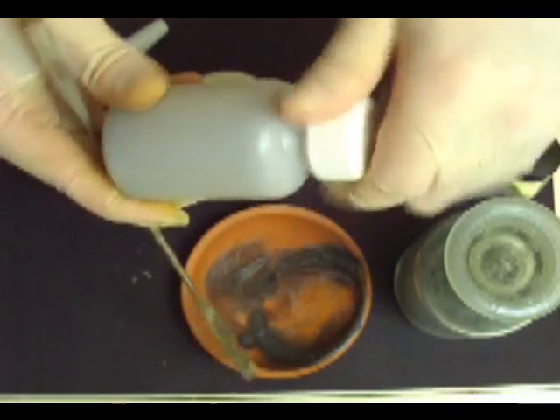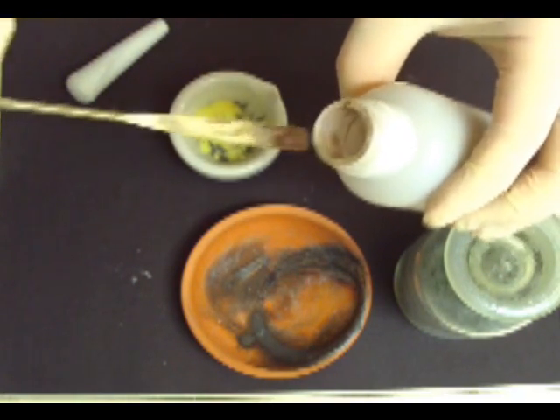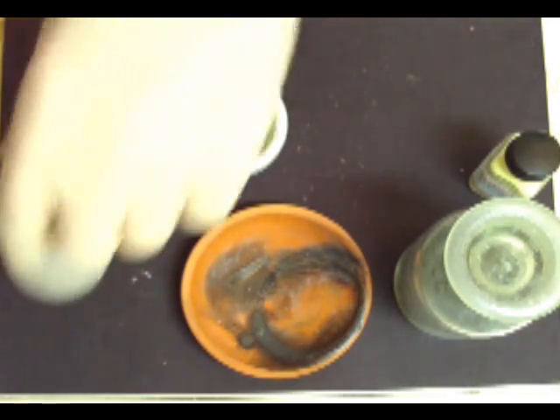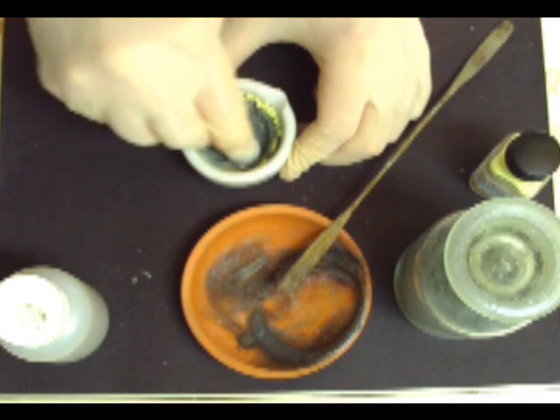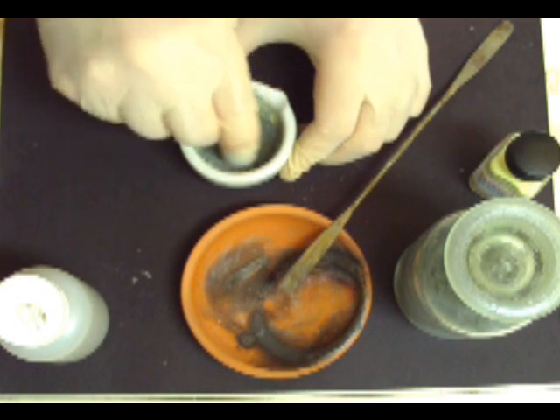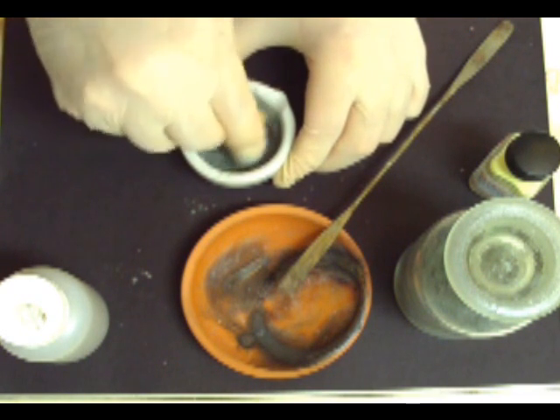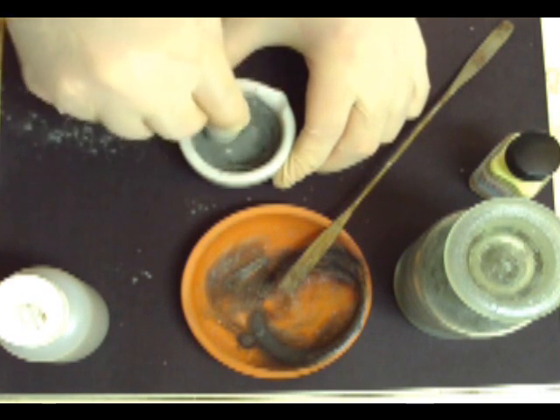Okay, now we're going to add some copper. You only need a very, very small amount of copper here. It just acts as an impurity and it helps the glow-in-the-dark effect, especially to try to make it last a little longer. Now you want to mix this stuff really well — you need to get all the clumps out. Sometimes sulfur forms small clumps, so get them all out and try to get it all blended together as best as possible. If it's not blended well, the end product will have some parts glowing and other parts that won't be. It's difficult to get uniformity in this reaction as it is.